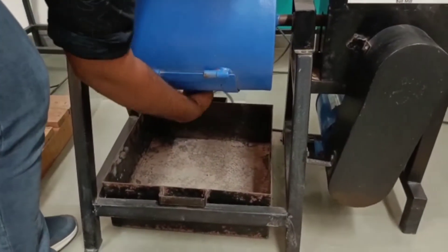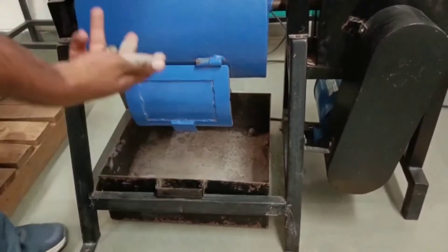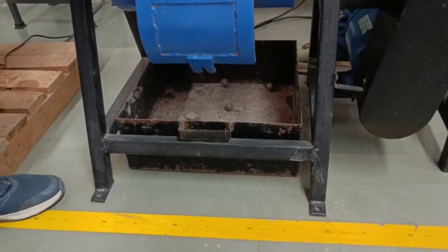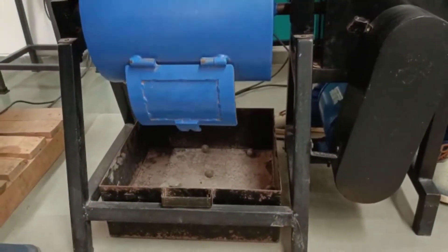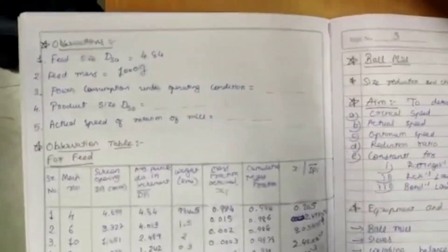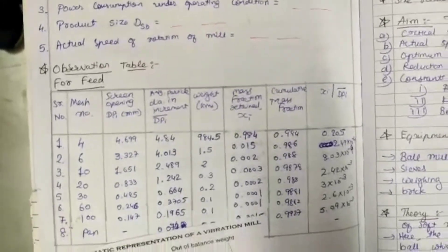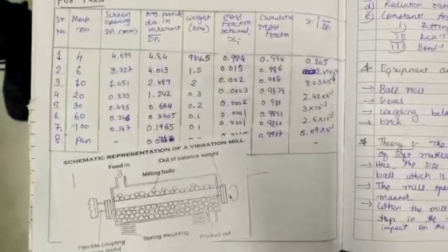We then remove the product from the ball mill. We observe that while removing the product, the balls may also come out. After removing the product, we proceed to do product analysis. We now draw the observation table for feed and product and calculate the Sauter mean diameter of both feed and product.